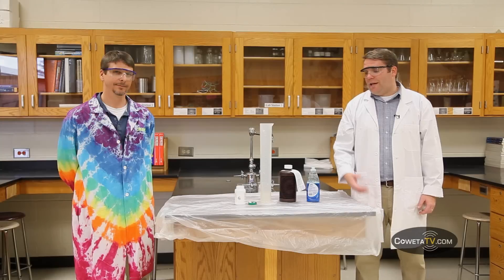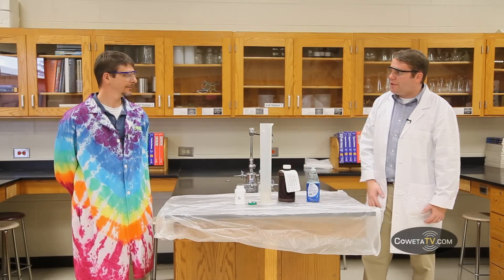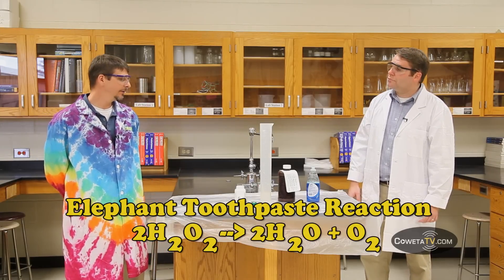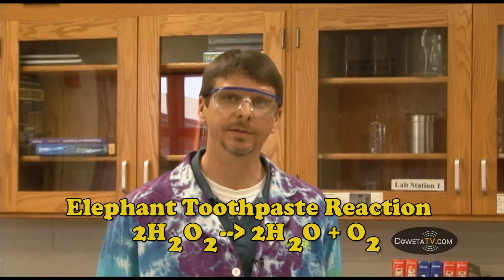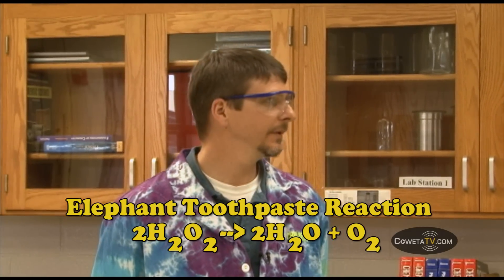Today's reaction does require us to wear personal protection equipment like safety goggles and our lab coat. Today's reaction is the decomposition of hydrogen peroxide. Mr. Sewell, you want to tell us about the reaction we have today? Yes, this reaction is going to use a catalyst to break down hydrogen peroxide into oxygen, that's going to create the bubbles in the tower and foam, essentially.